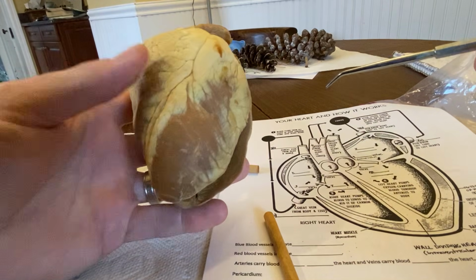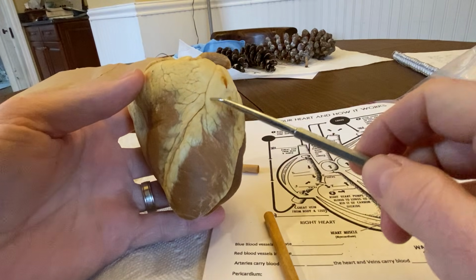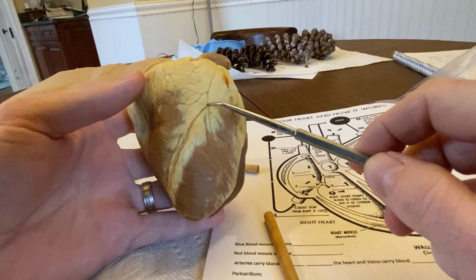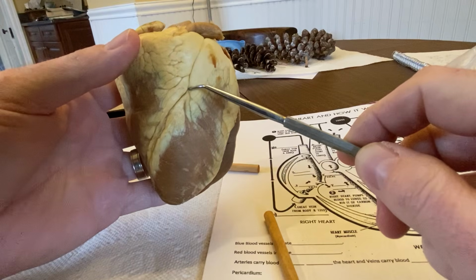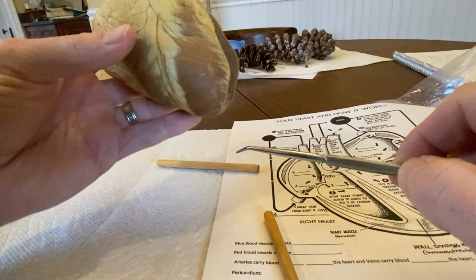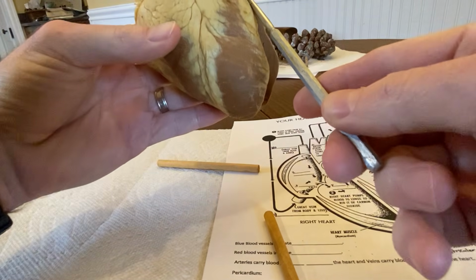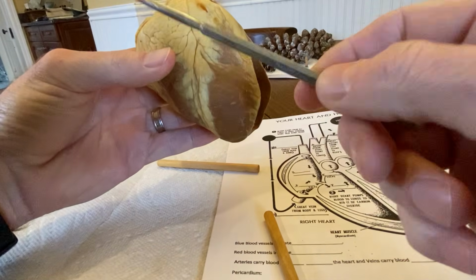Nice little review. All right, so in terms of external anatomy, the first thing that usually jumps out at people is this diagonal line going right here. This diagonal line is actually the line between the two ventricles, okay? So remember the heart, we call it right and left, but the heart sits like this in a person's chest, okay? It points to the left. So remember, this is going to be the left side because it's sitting in a person's chest, right? If somebody was standing in front of me, this would be their left and their right.